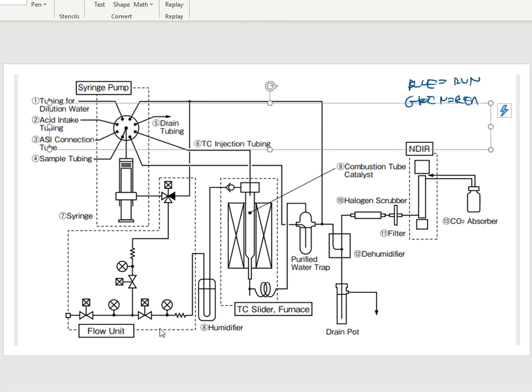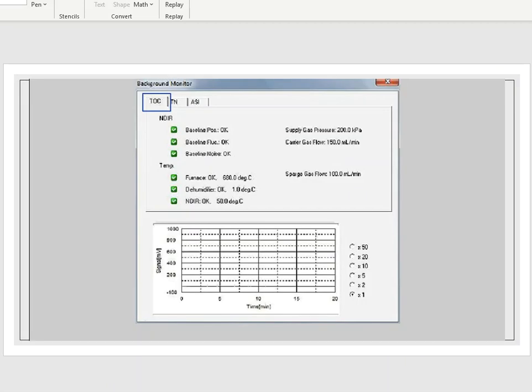All right. So with that said, there is a box on the software. This is what it looks like. And there's a couple of check marks on this box. If I go through and look at this tab, the tab up here at the top is TOC. That's my TOC analyzer. That's the main one that has all the pieces and parts in it. It looks like there's an NDIR section, and it also looks like there's a temperature section. Okay, so if I look at this a little bit closer, it says baseline positive, and it says okay. Then it says baseline fluctuation, and it says okay. And then it says baseline noise, and it says okay.